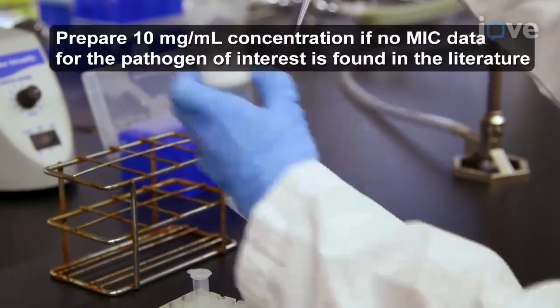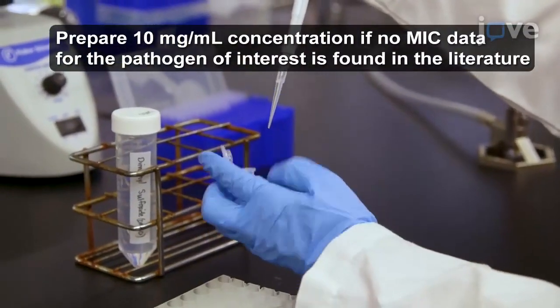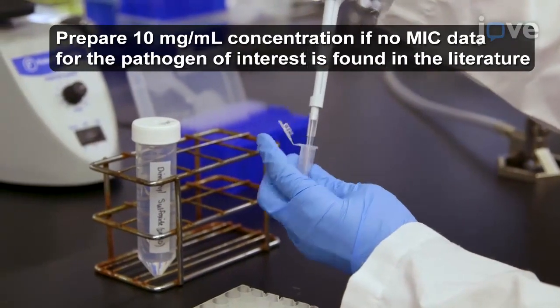Then dissolve the small molecules in dimethyl sulfoxide at a high concentration above 10 mg per milliliter.